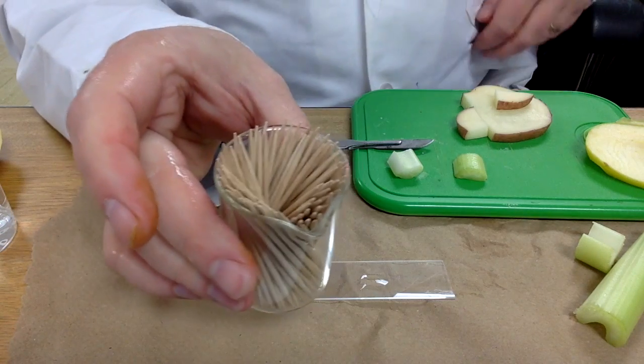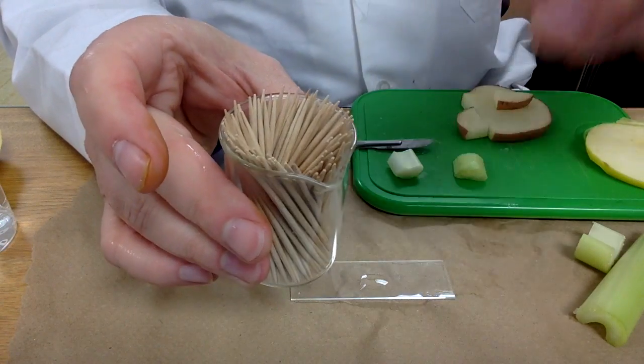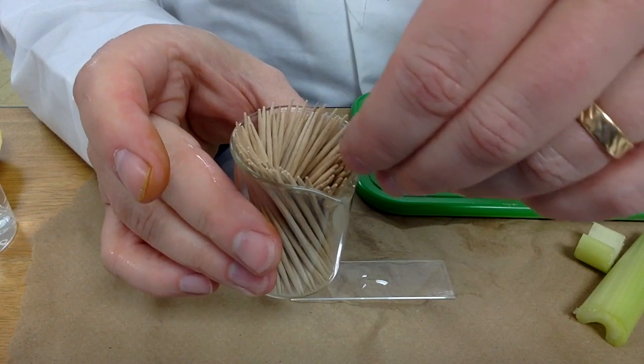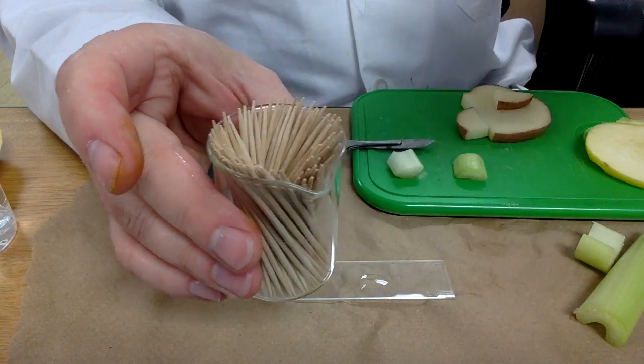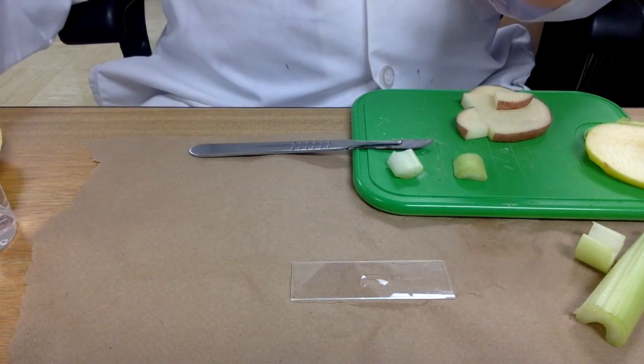Get a sterile toothpick from your teacher. When you take the toothpick, try to just grab the edge so you don't touch all the other toothpicks.